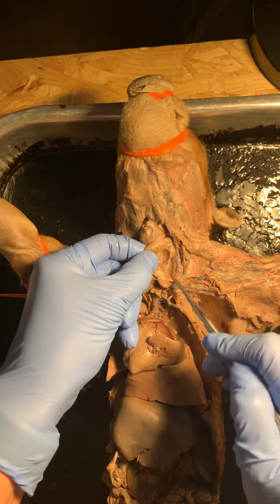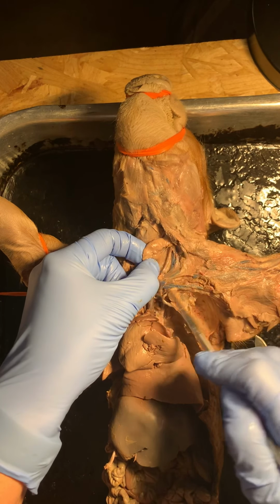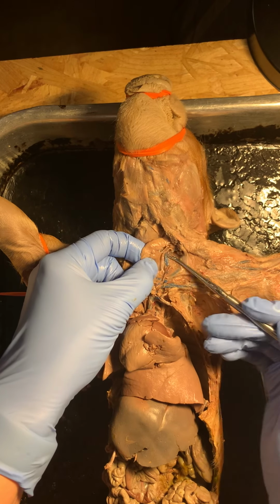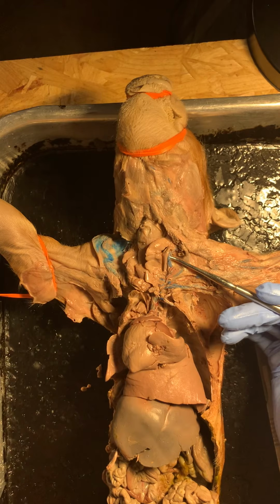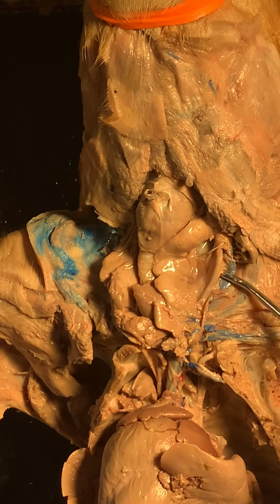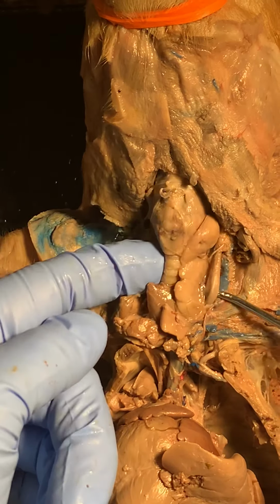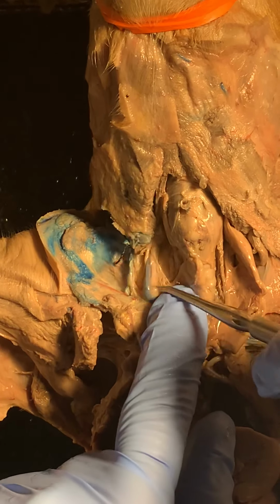we have two blood vessels, and usually the dye runs through both of them, but we have a blue one and we have, sometimes it's pink, sometimes it's more neutral colored. And these two vessels, the blue one is the internal jugular vein, and the neutral or pink colored one, this would be your common carotid artery. It is bilateral, so we do have it on the other side too as well.